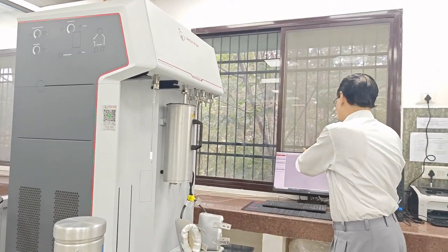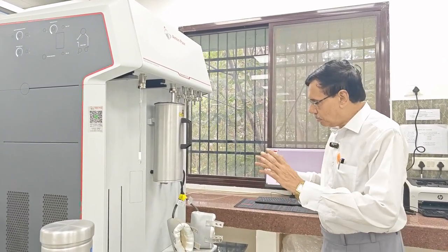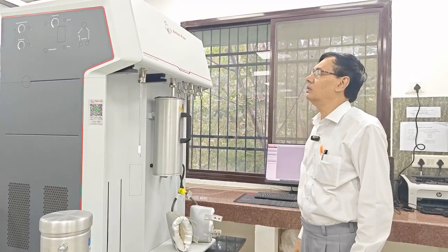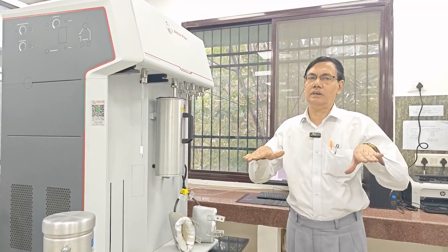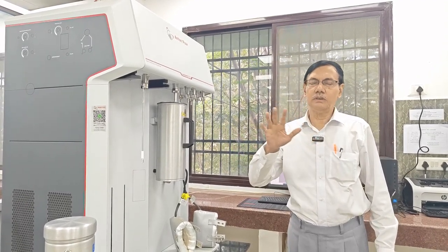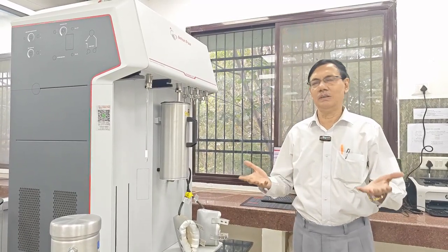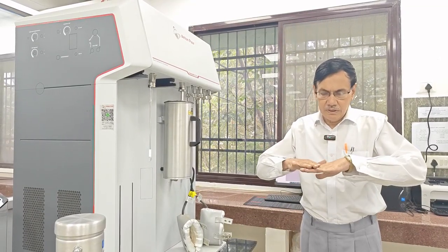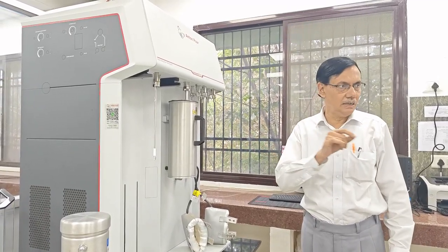And the third part is the software part. Before that, there are two steps. First, we will weigh the sample, and Dr. Rajiv will tell you which type of sample you will take. It may be a solid sample. If you are MSc or PhD students, you all know about the adsorption isotherm. It is very simple: the extent of adsorption on a particular solid surface, and the gas we are using is, I think, nitrogen gas.